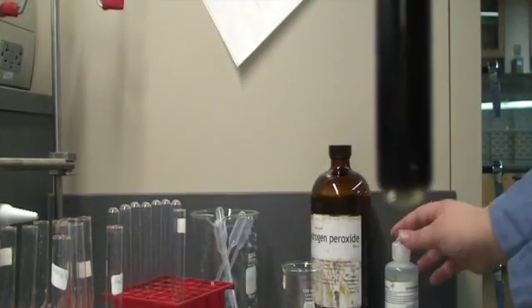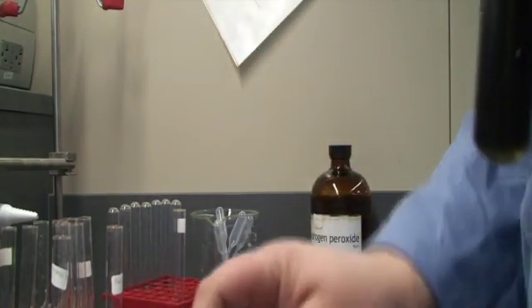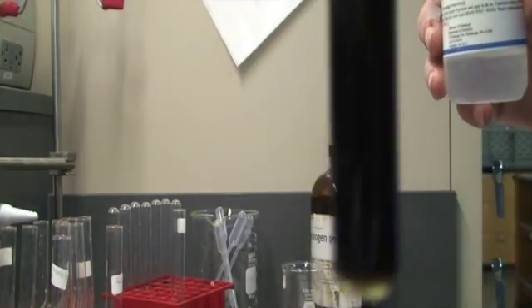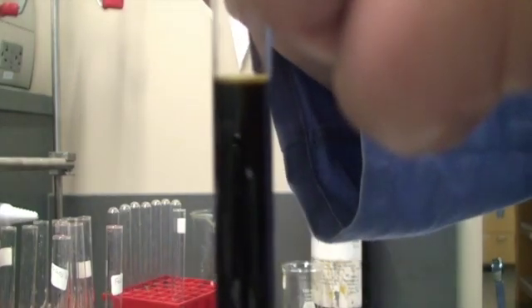So now I have some 3 molar NaOH in this dropper bottle. I'm going to add the NaOH drop-wise to see what happens. Let's do 5 drops first.